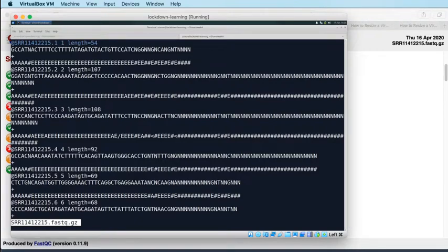If this was Illumina data, directly from an Illumina sequencer, this identifier line would look quite different, and it would contain a lot of metadata about the sequencing. We can talk more about that at some point if it's appropriate, but it doesn't matter right now because we don't have that information available to us.